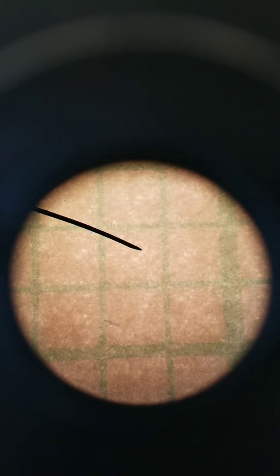We want to use micrometers, with a Greek letter mu and the letter m as an abbreviation, as a unit for measuring cells and things that we see under the microscope, because cells are really, really small, so we don't want to use millimeters, otherwise you'd be using decimals all the time. So it's better to use micrometers. So 5 millimeters in micrometers would be 5,000. There's 1,000 micrometers in 1 millimeter. 5 millimeters times 1,000 is 5,000. That's at a total magnification of 40x.